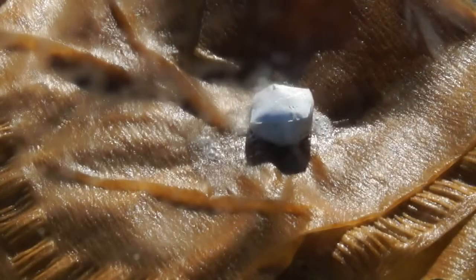I also managed to shoot the behavior of sodium on the surface of a wet filter. We can clearly observe the spheroidal state which the burning sodium droplets acquire after becoming transparent.